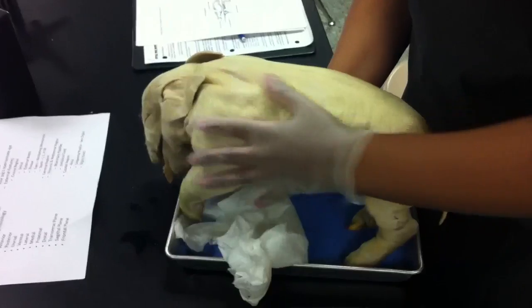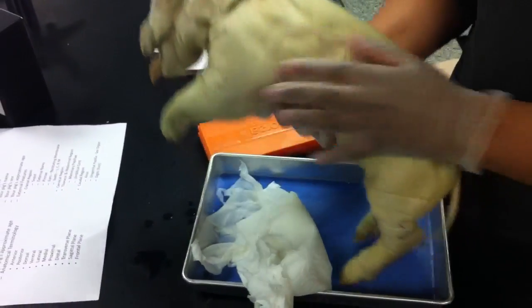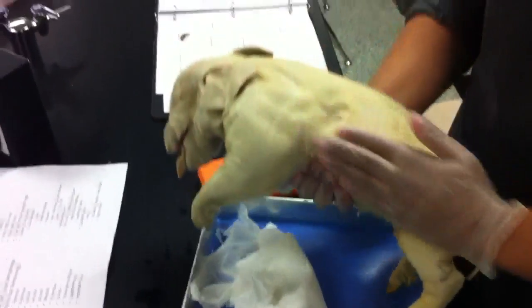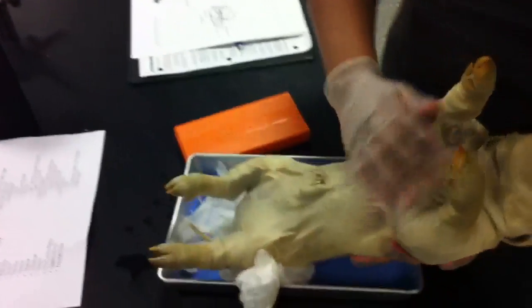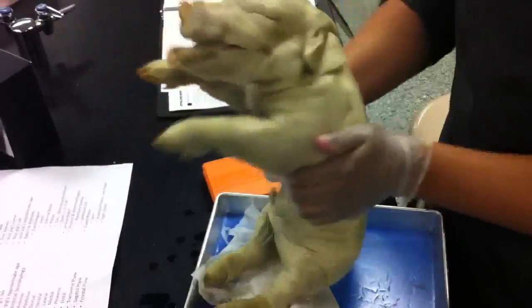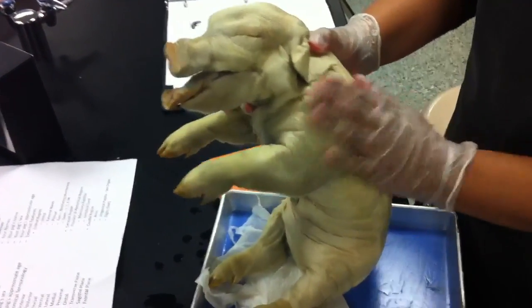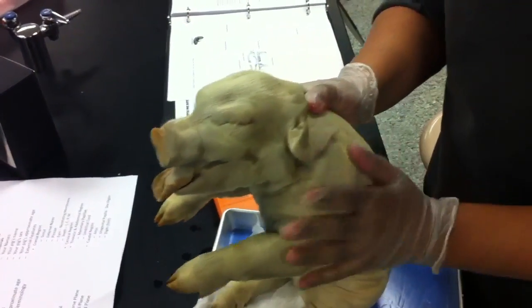This is the anterior region of the pig's anatomy. This is the posterior region. This is lateral. This is dorsal. This is ventral. This is medial — it goes right down the midline. This joint right here is proximal to the body. His digits are distal to the body.